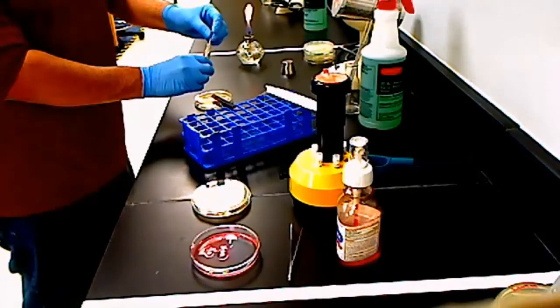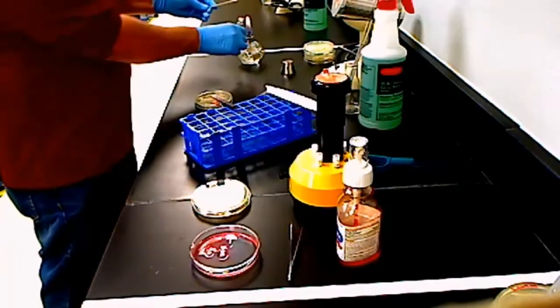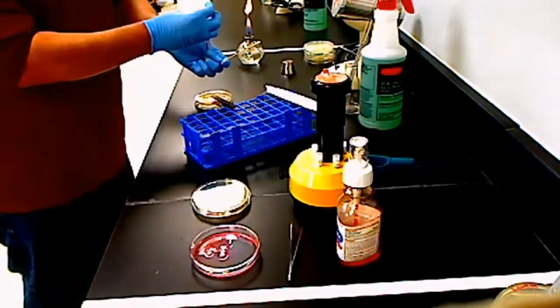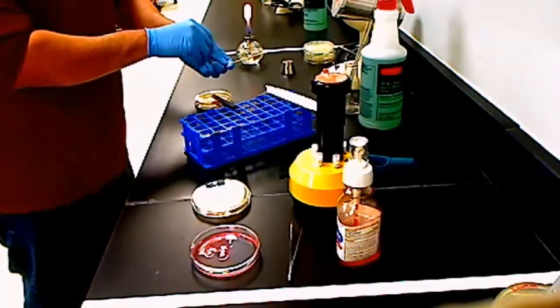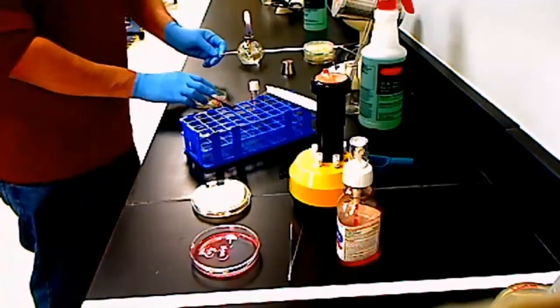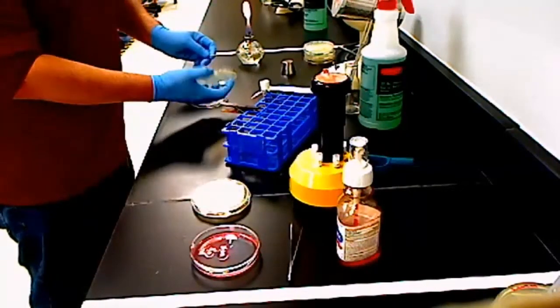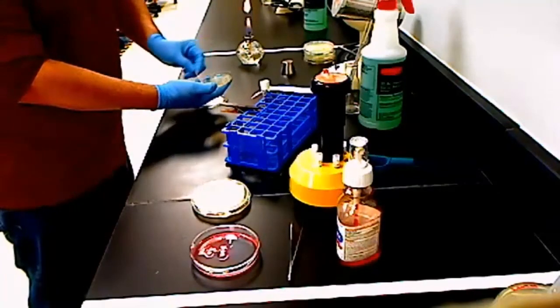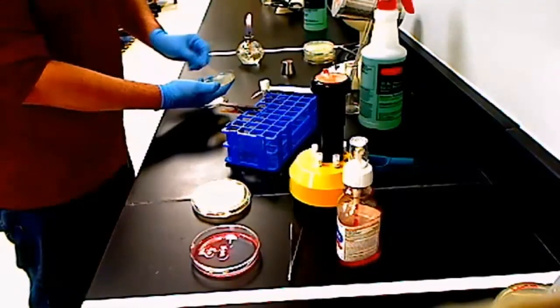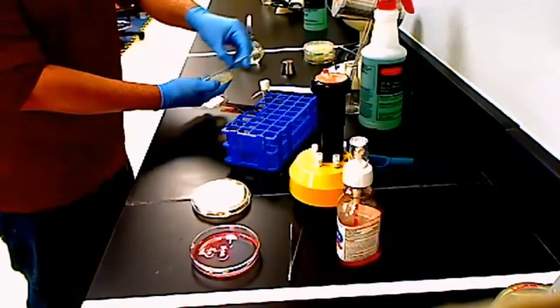And what we want to do is make what's called a lawn. So I'm going to make sure and grab a bunch of microbes. That swab's going to be all wet. I flame the tube, and then I close it. Okay, now my microbes are all on the swab here. So remember, your plate is upside down in front of you. To inoculate it, you pick it up, and you just go back and forth across the surface of this plate. You're going to completely inoculate the entire surface of this plate.